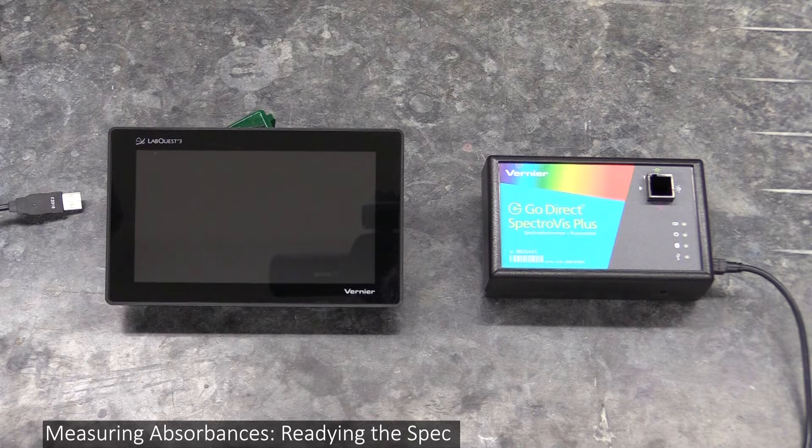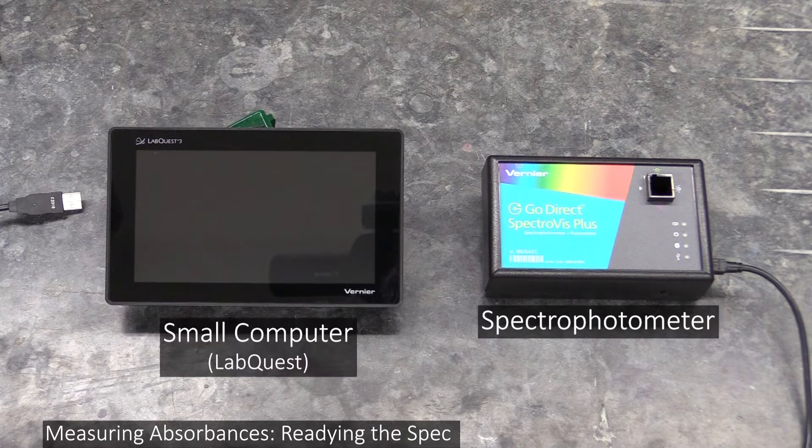Once you've got your solutions made, the next thing you'll do is measure their absorbances with the spectrophotometer, which you'll control with a small computer.